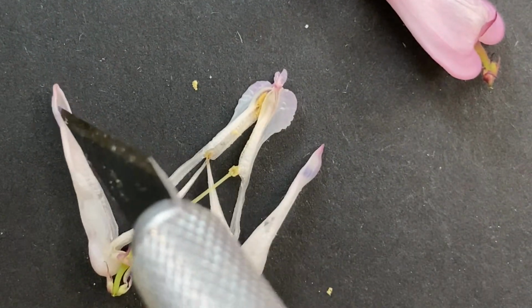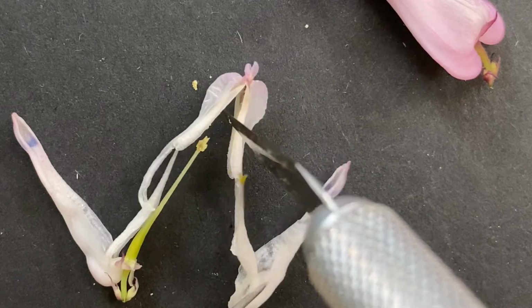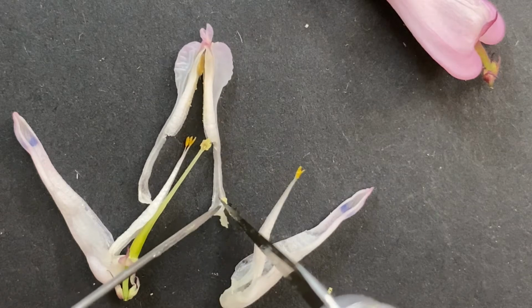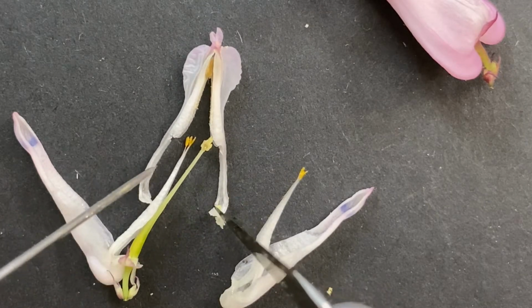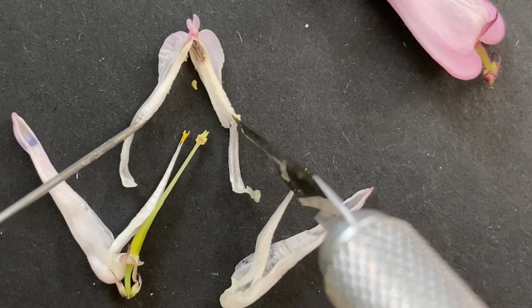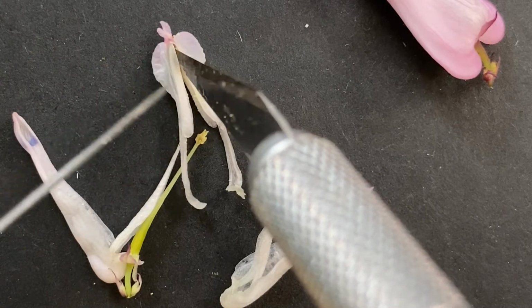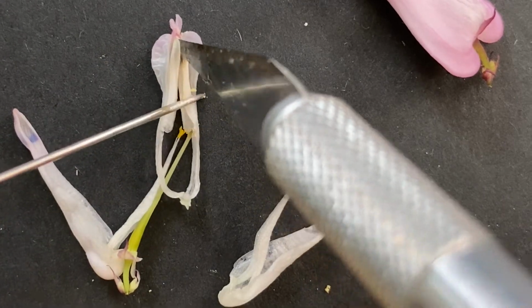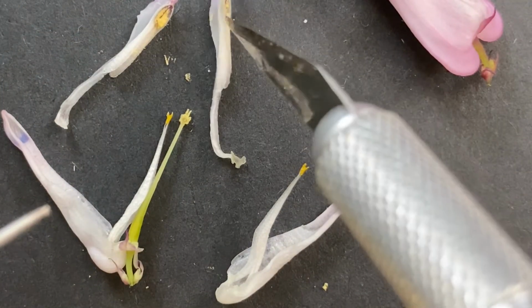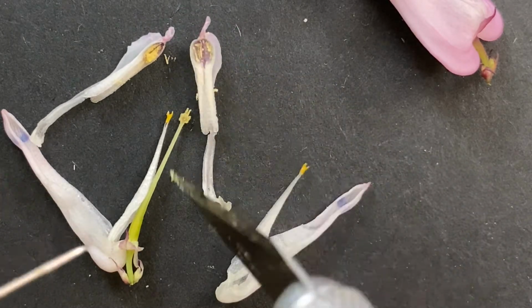So here we go. We've got sepal, sepal, and the corolla is really cool. So the corolla is almost inverted. See how thin it is down here at the base? So the petals are real tiny, and then they get bigger, and they close up like this. So you can just cut them open down the center. And let's see, get it all the way through. Yeah. All right, so that's that little cavity there at the base where it gets self-pollinated.